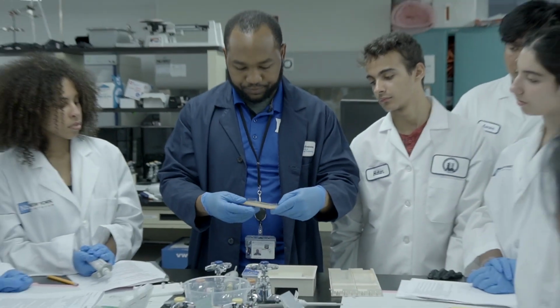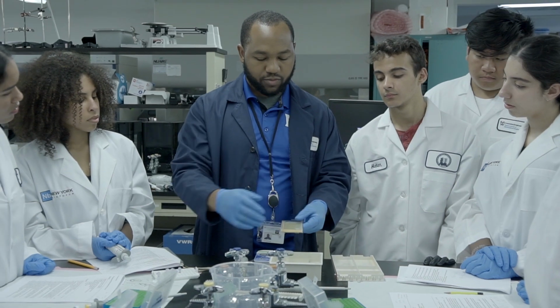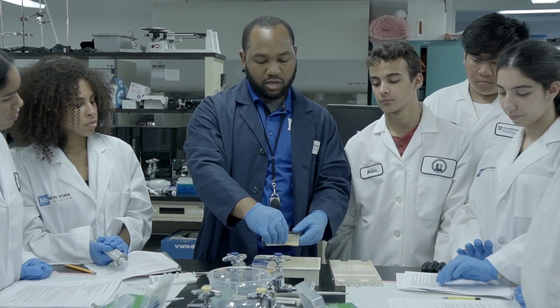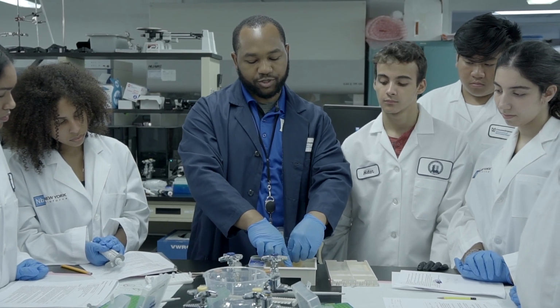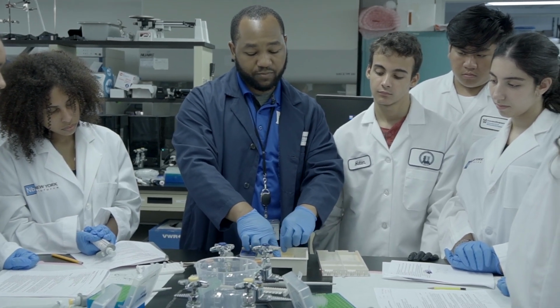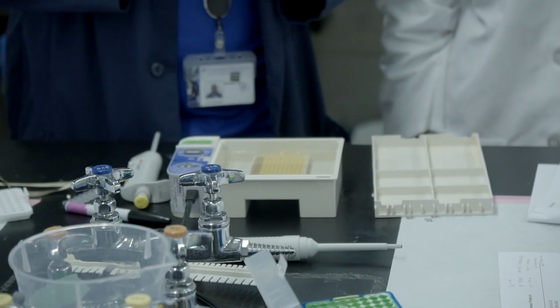Just like this. Okay. This is where my voltage originates, and so I'm going to make sure it's flowing this way down the lanes. And so I'm just going to press it in here. I've added 300 milliliters of my TAE buffer that I made, and you can see here everything is very clearly submerged. Okay, that's the goal.